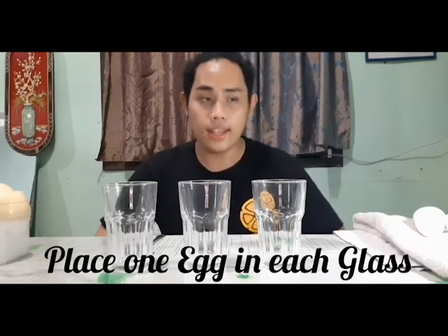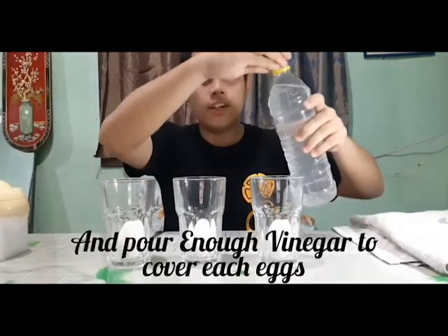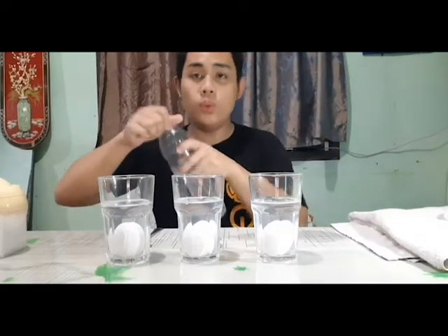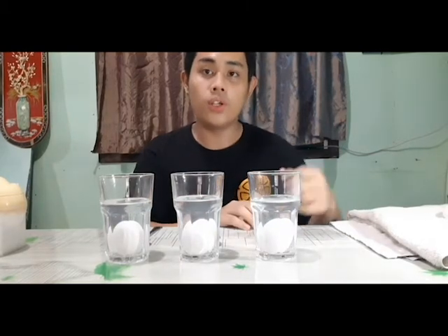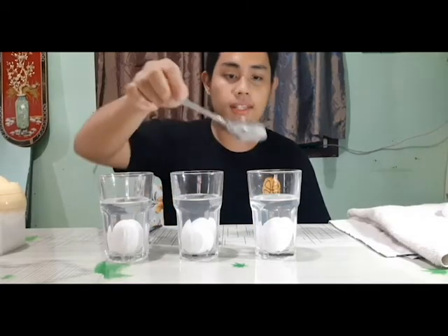Place 1 egg in each cup and pour enough vinegar, and you will then see bubbles start to form around the egg, and soon it will float. To keep it submerged, we use a spoon to hold it down.